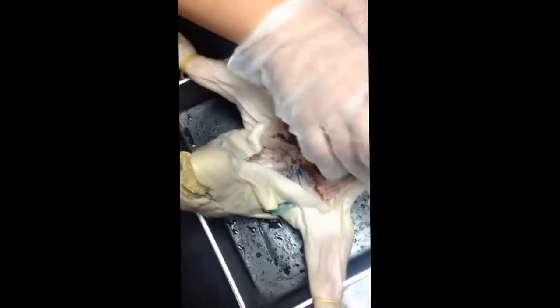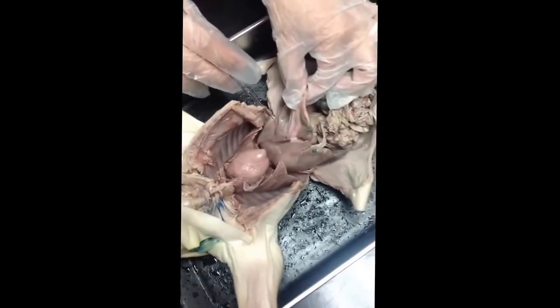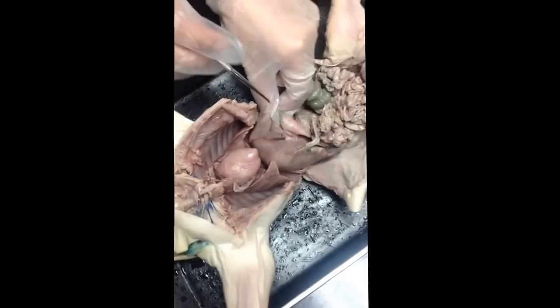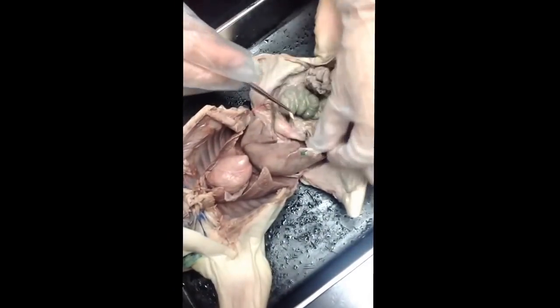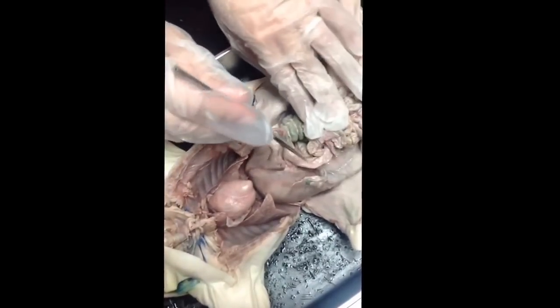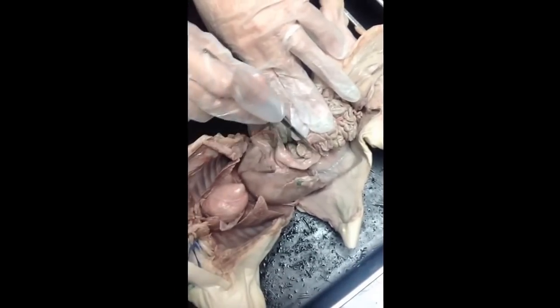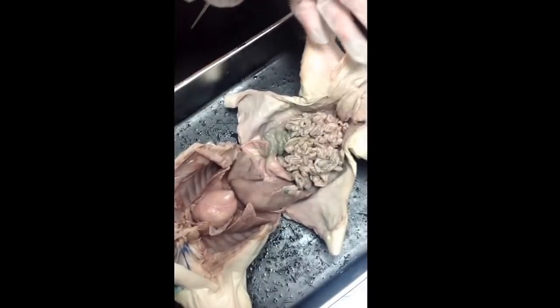From the esophagus, that food will then go down to this pouch, which is the stomach. The stomach has a very thick valve at the end. This valve is the pyloric sphincter. The pyloric sphincter is then going to lead that chyme into the small intestines. So the initial curvature of the small intestines, that is the duodenum. Everything else we're going to call jejunum.